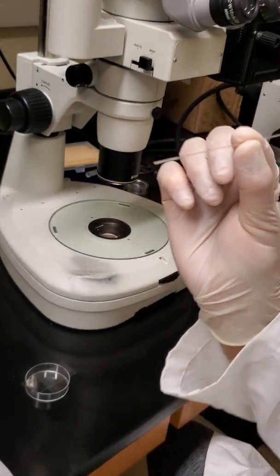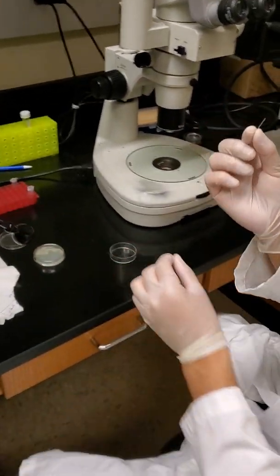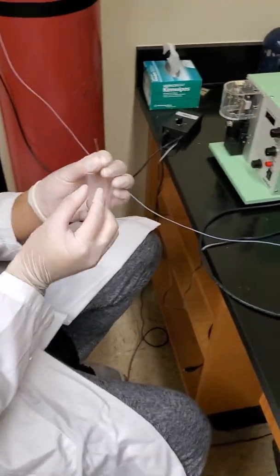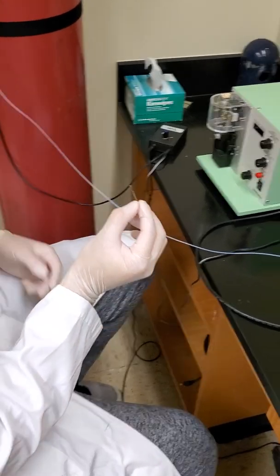There it is. If you're using a CRISPR-Cas9 DNA mix, you just pipette. Do you know the volume you pipette? Is it 1 microliter of the DNA? 1 microliter into the needle.